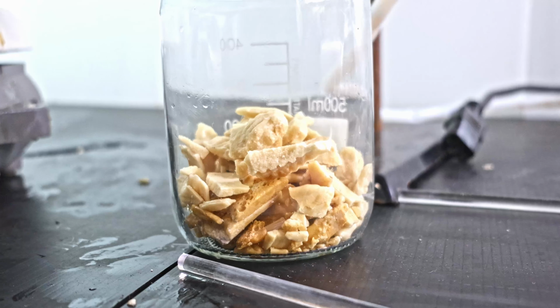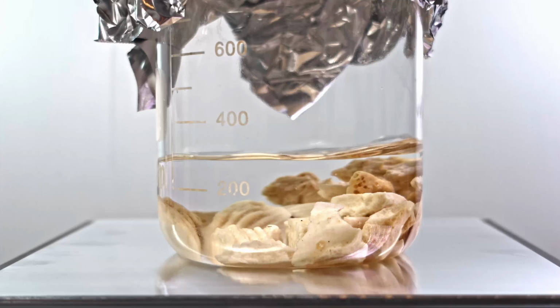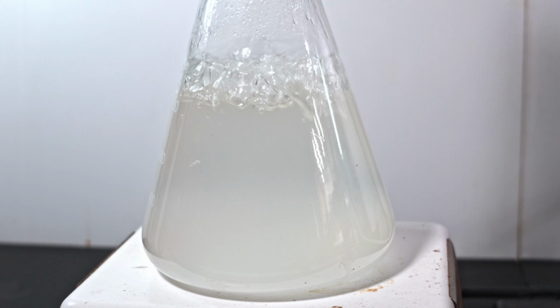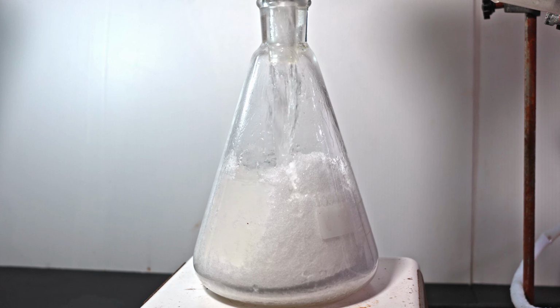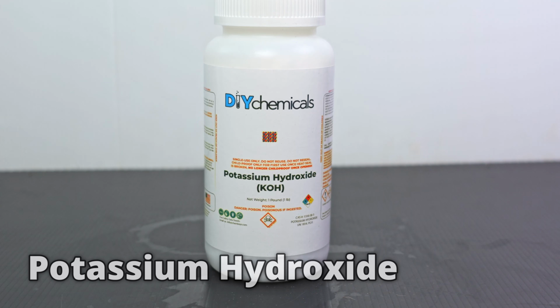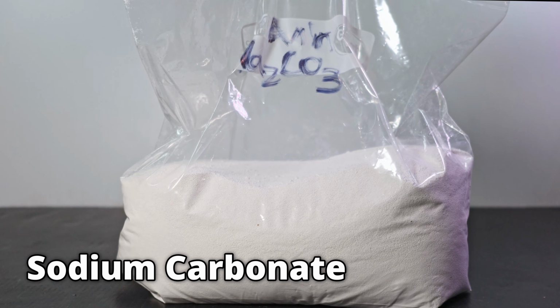Potassium ethoxide is a very common organic base used in E2 and SN2 reactions, Claisen condensations, and some ether syntheses. It's commonly made by adding potassium metal to ethanol, but today I'm going to try to make it metal-free. The materials you'll need are ethanol, potassium hydroxide, methanol, and anhydrous sodium carbonate.